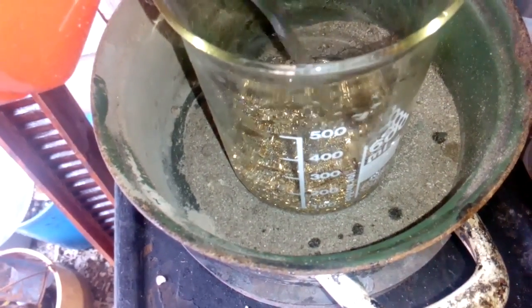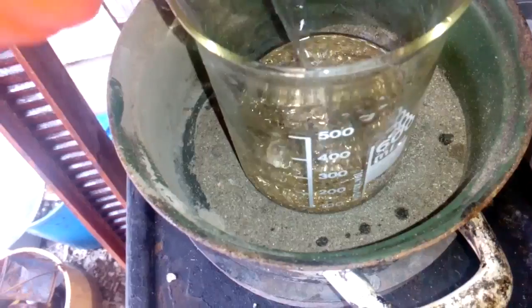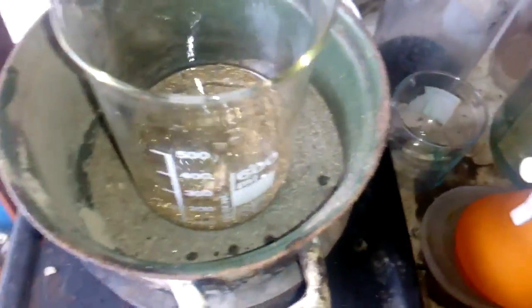But first I must show you what you need to do before you do that. Okay, let's go to work. In this setup I got 140 gram CPU pins, fiber CPU pins, and if you could see inside, they contain a lot of lead, tin and other stuff. So what we need to do first before Aqua Regia is to boil them in the HCl, to remove all that tin.